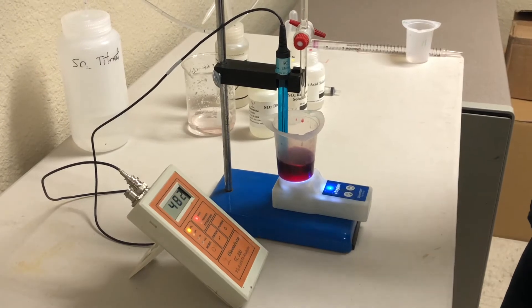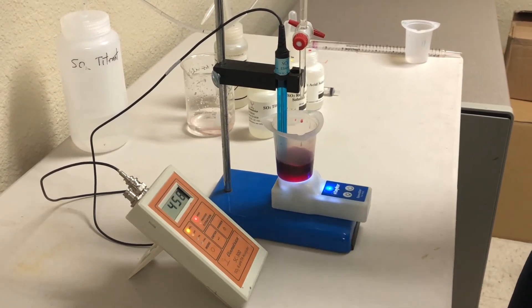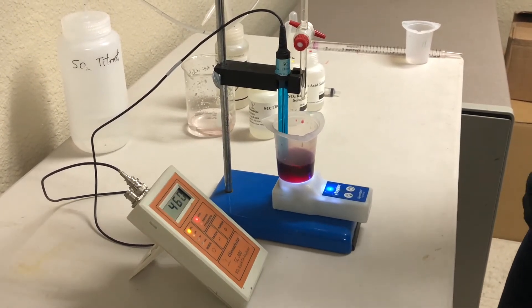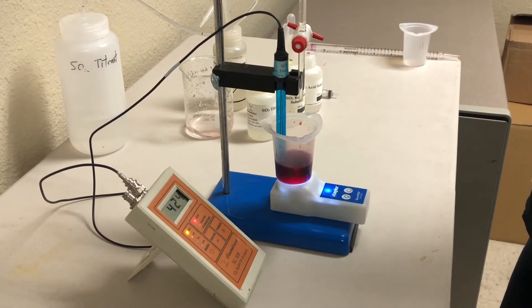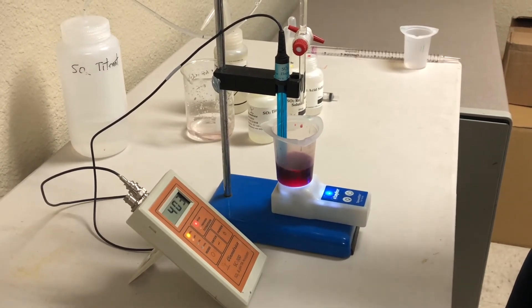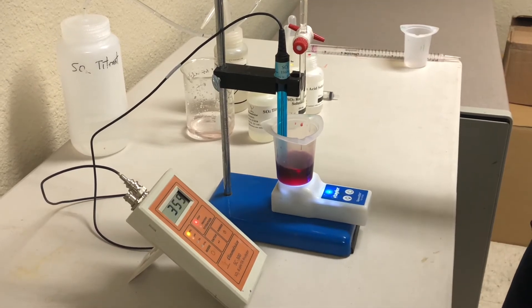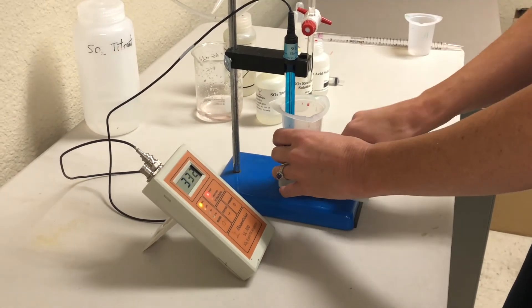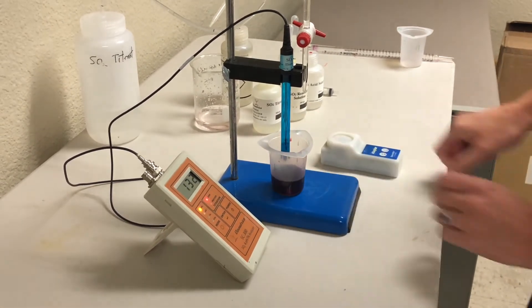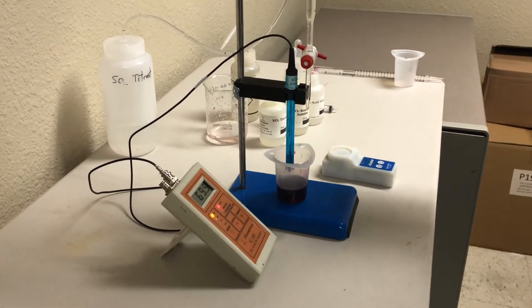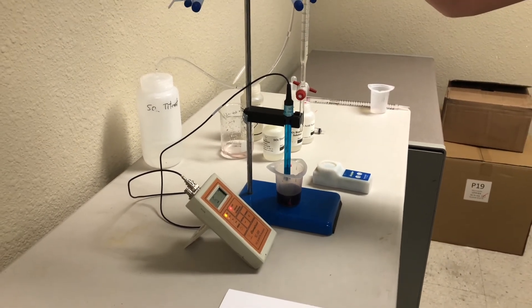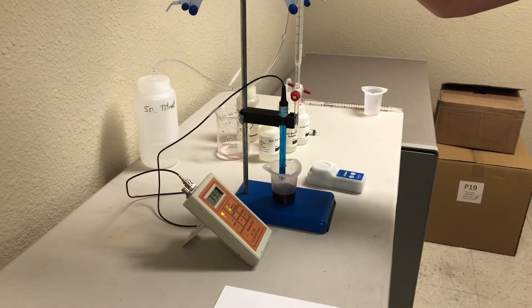So now, I've reached my end point, and I need to count 20 consecutive beeps, and that means I have finished the test. I've counted 20. I'm done. I can turn off my magnetic stirrer, remove the wine sample from the SO2 electrode, and I will make a note of the volume I've used during this test.